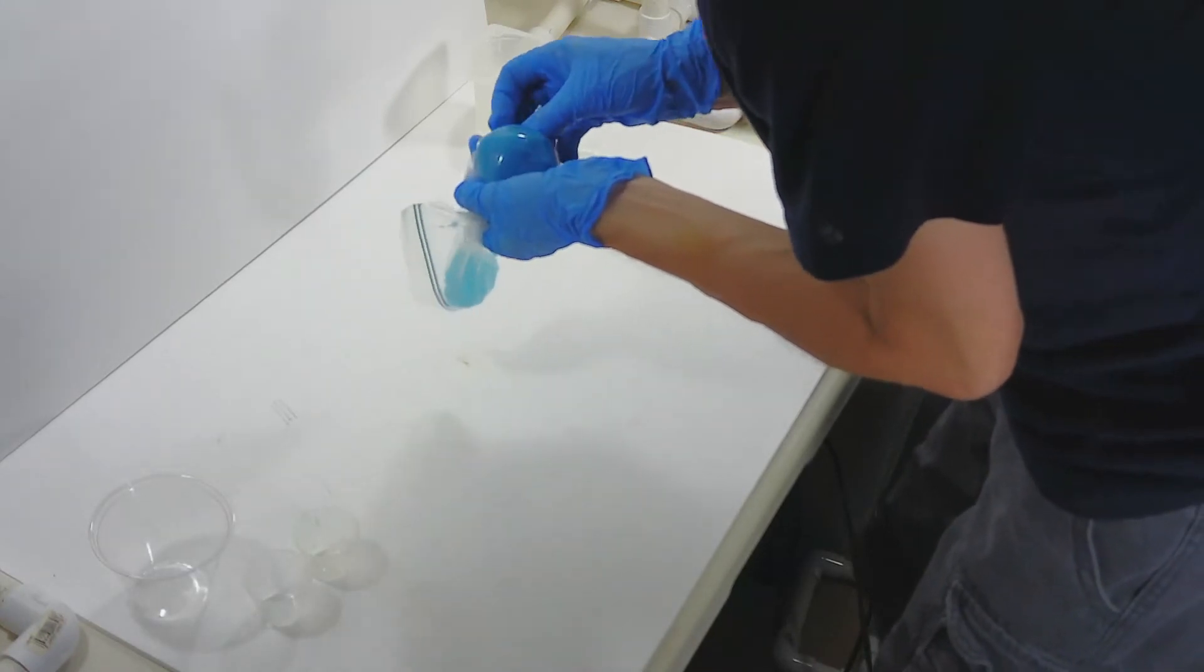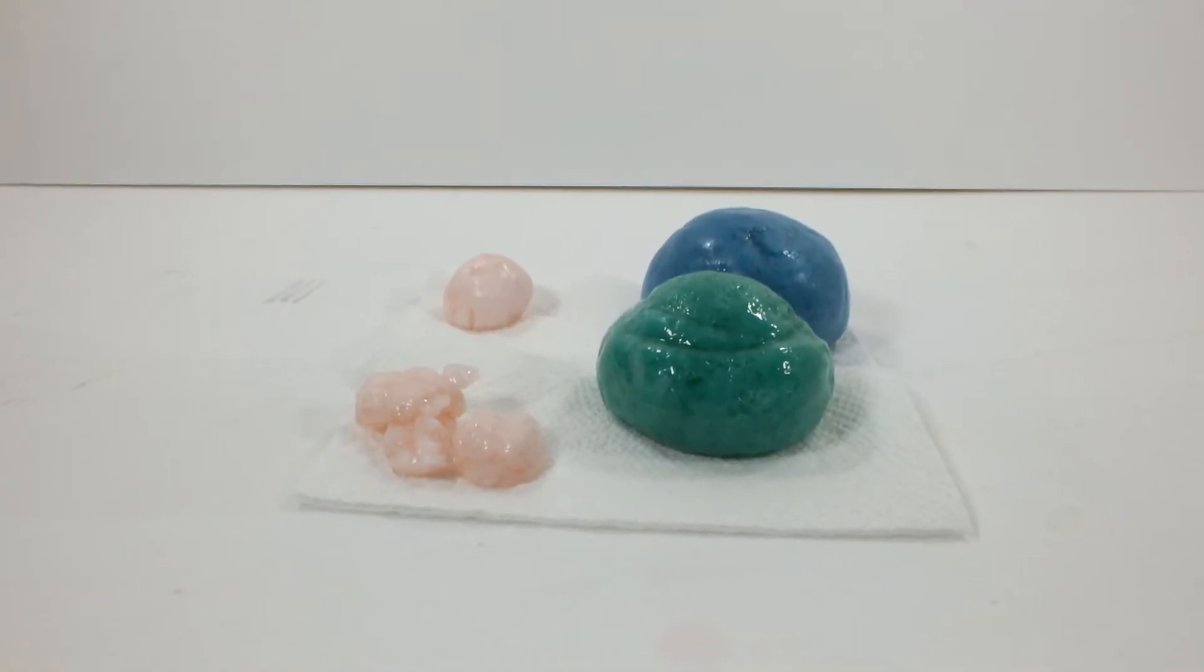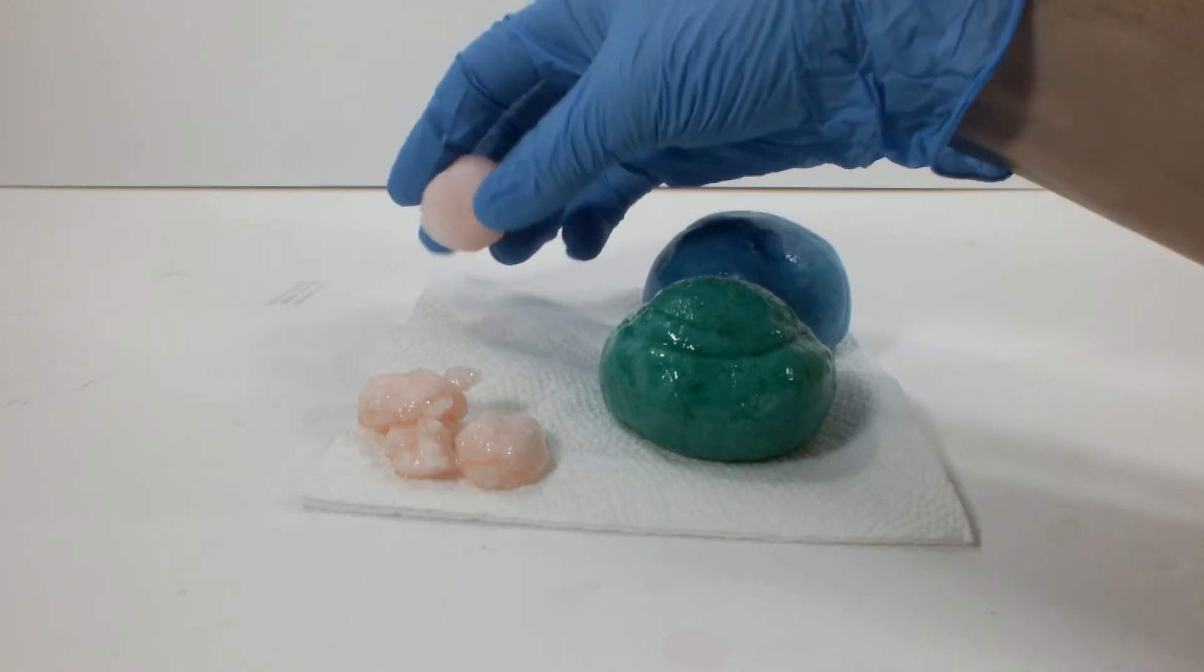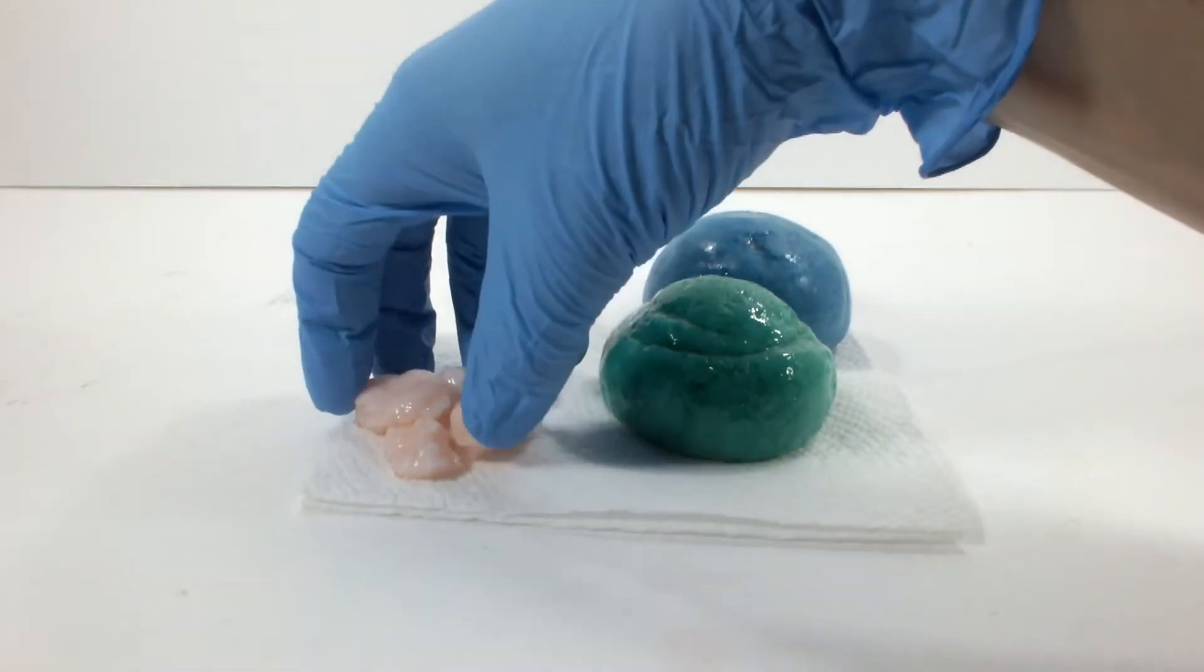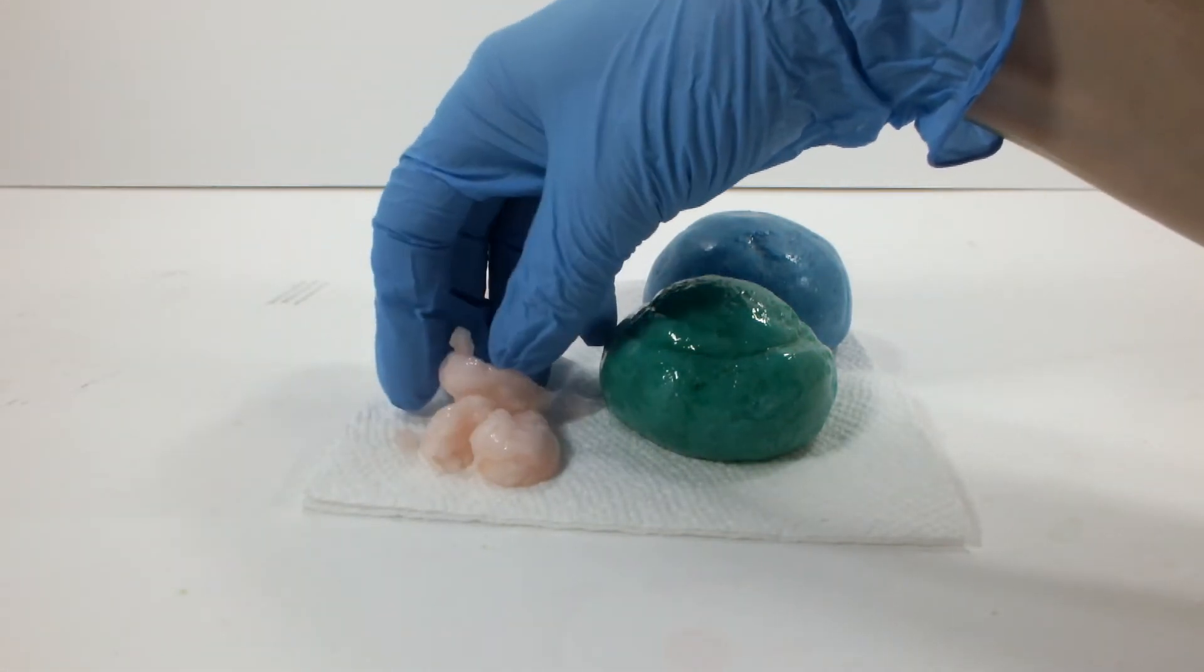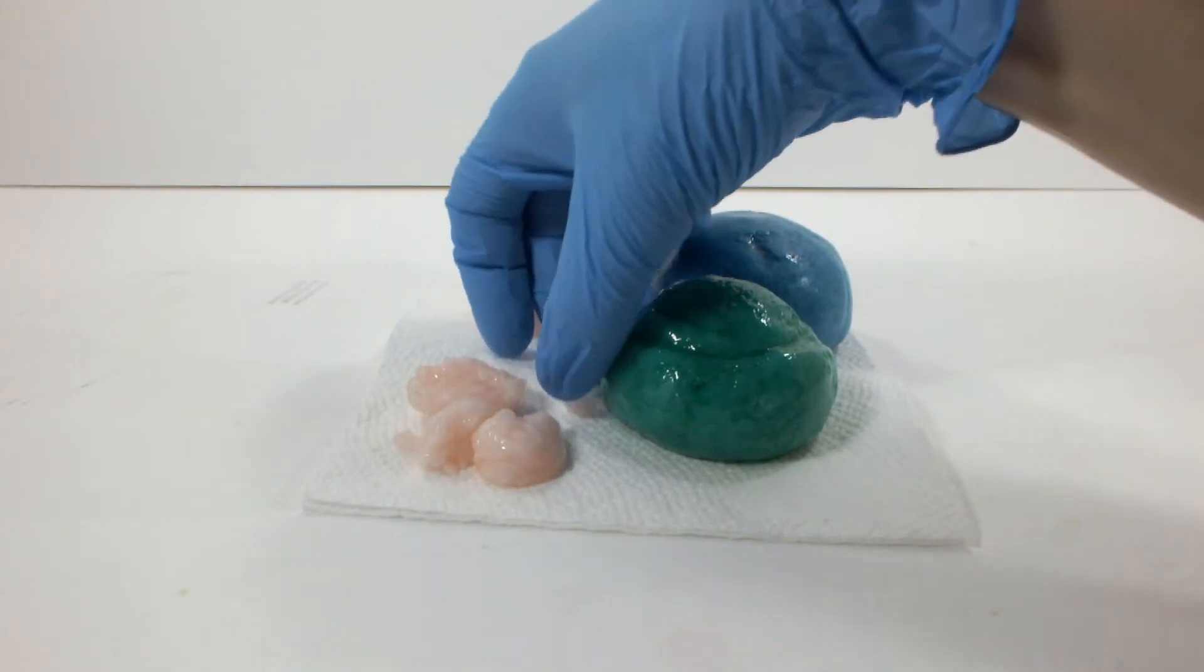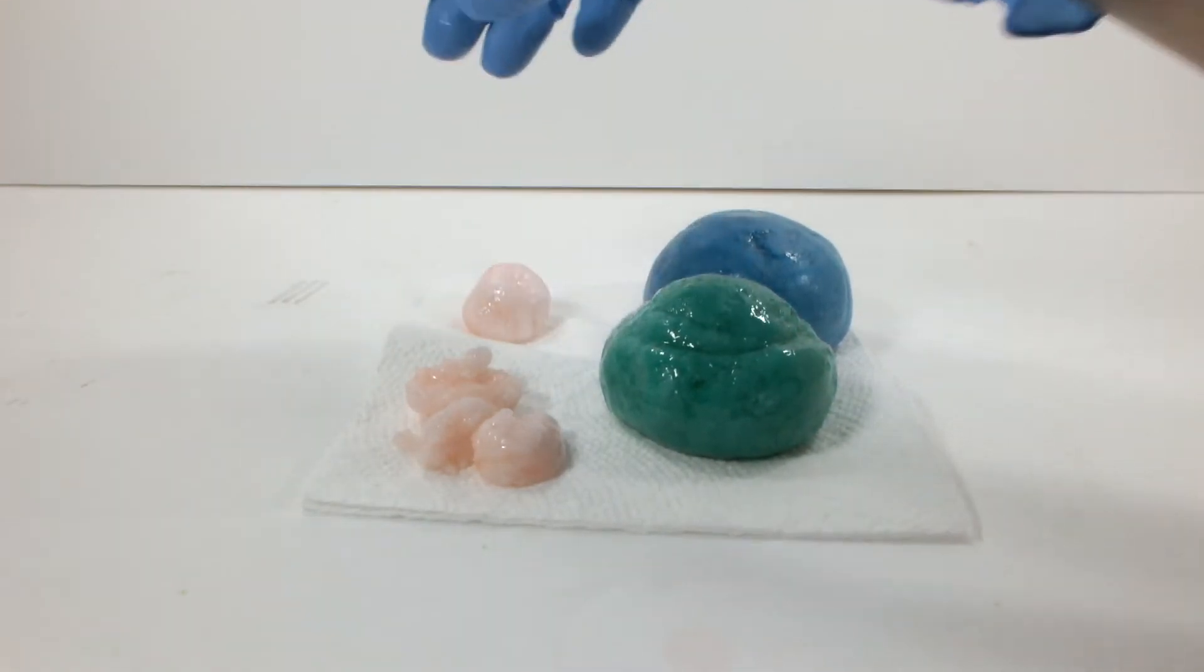Oh well. Let's have a look at what we made today. It's a pretty dismal looking group. Okay, here's the results. We've got this first guy, and they're all really hard now. This one was not wrung out completely, and it's still quite moist. These are all the alcohol rather than the vinegar one. That one was just garbage. I would say that these red ones that had the added water, no good.